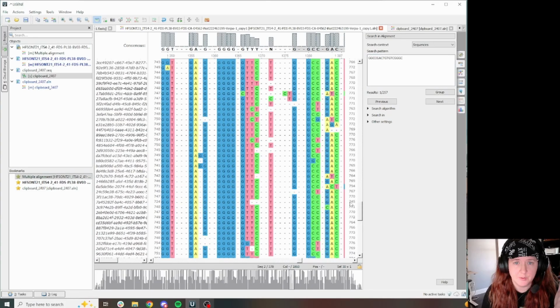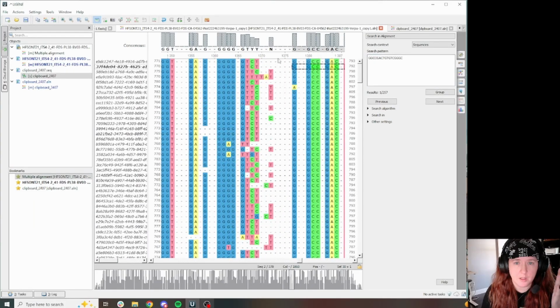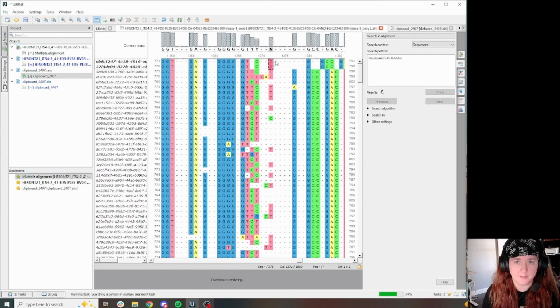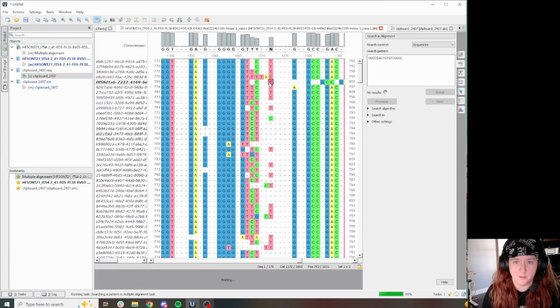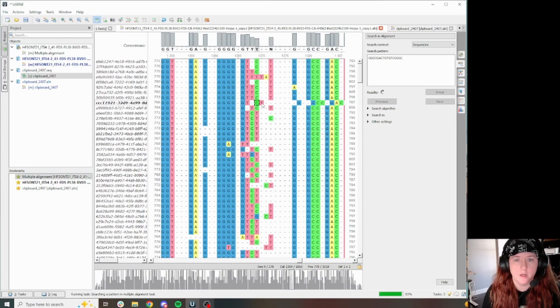because these C's, when you look at them, this CT motif slots very nicely to where these empty slots are on this N, right? So what I sometimes start doing when I see these is just kind of start doing a little bit of a manual realignment because you gotta remember this is just a computer algorithm, right? And computer algorithms can make mistakes.